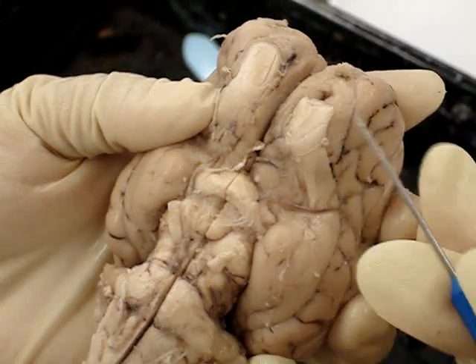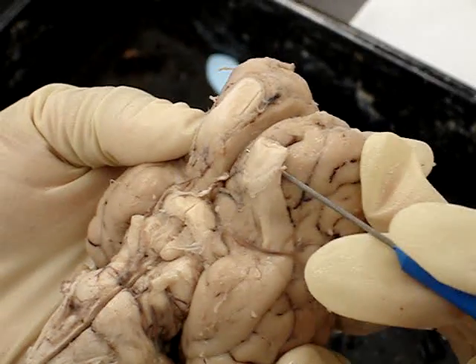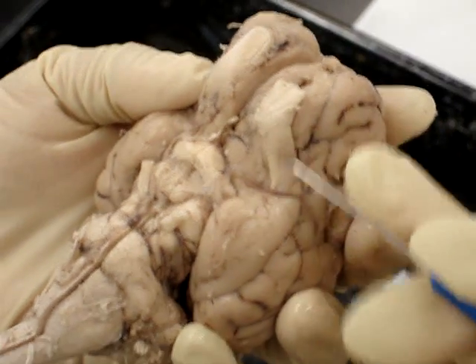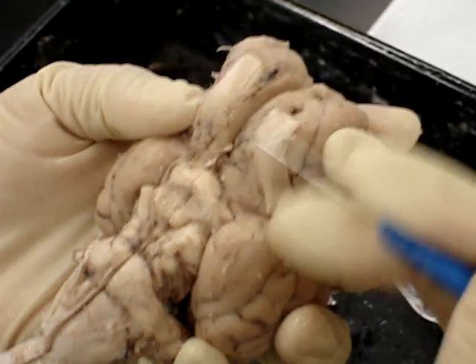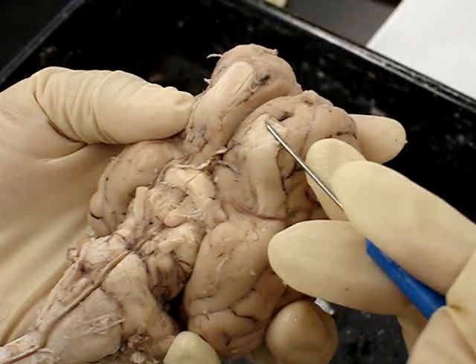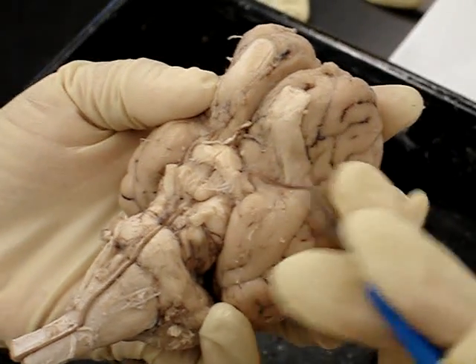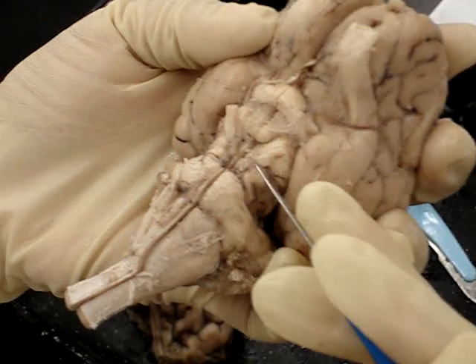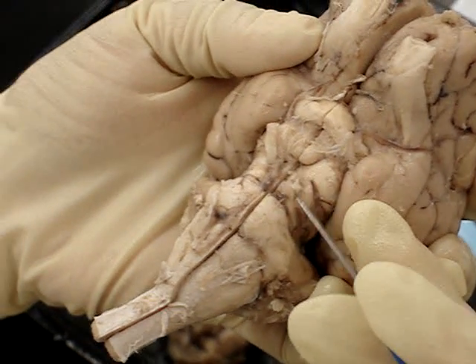The olfactory bulbs are these huge things. This is also the olfactory nerve — it's continuous, you can't really tell them apart. So that's CN1. CN2 is here, and this is the oculomotor nerve — it's huge — it's CN3.